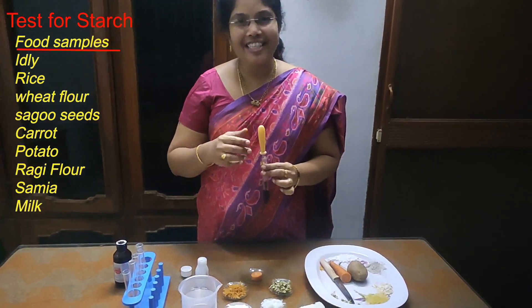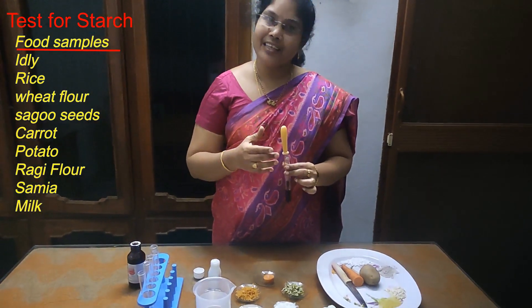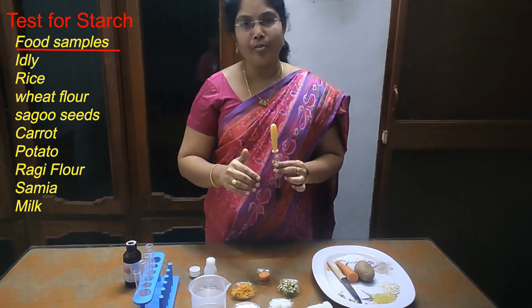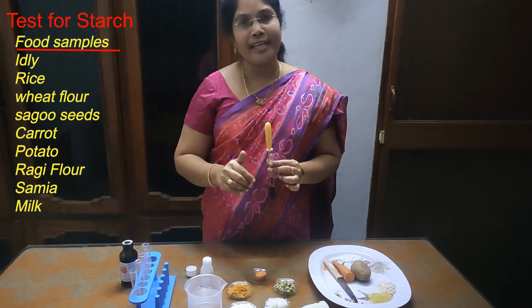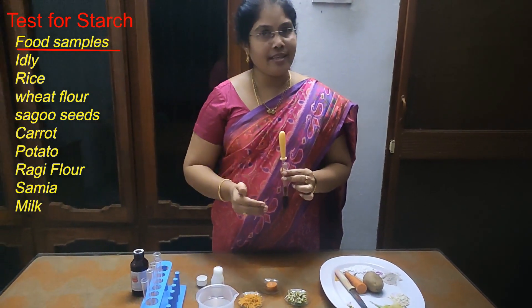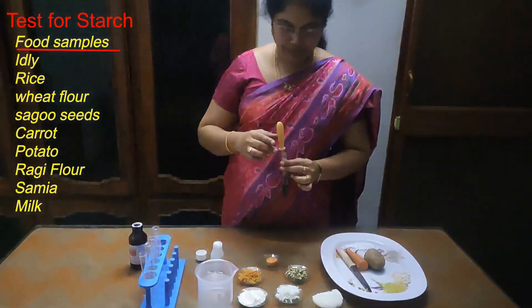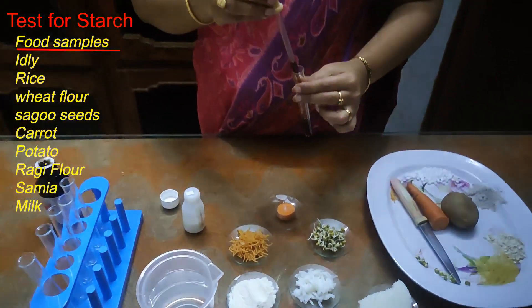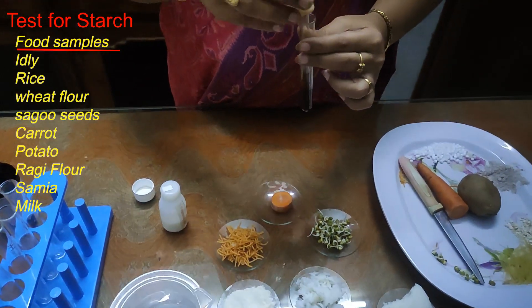If the food changes to black or dark blue color, then we can confirm that the food contains starch. So let us see one by one.